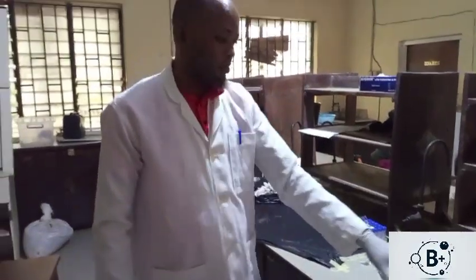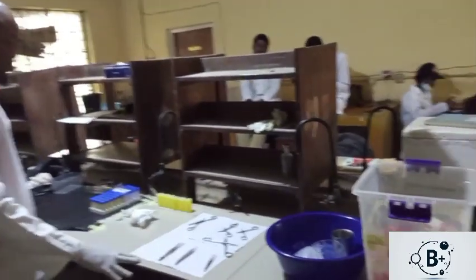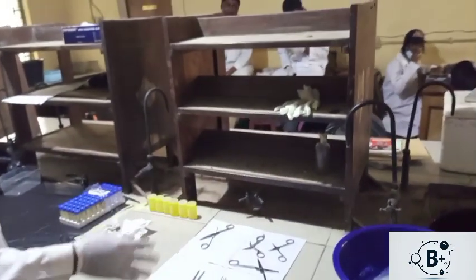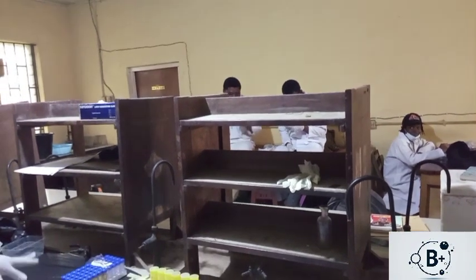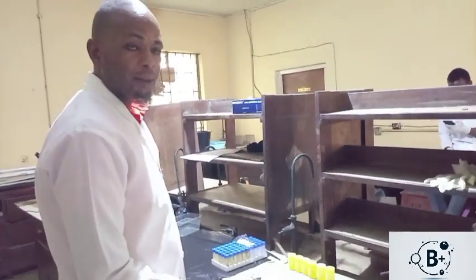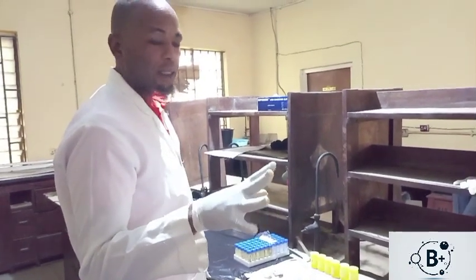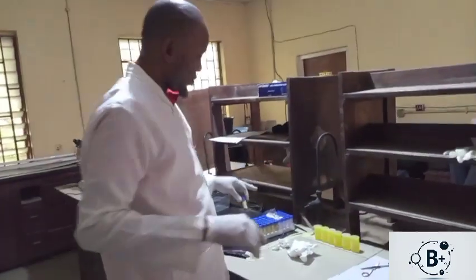Then we have the surgical instrument sets, which have been used to have the excisions done. So we have excisions, and this particular study is centered on the epididymis and testis. That is the main one. Then we now take the blood sample that I did mention.